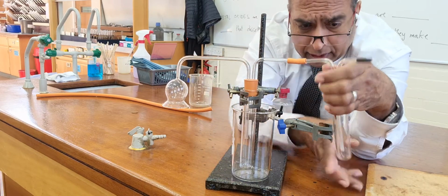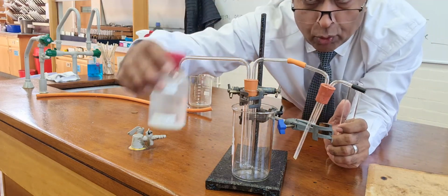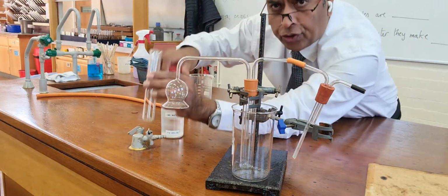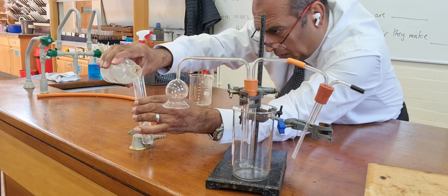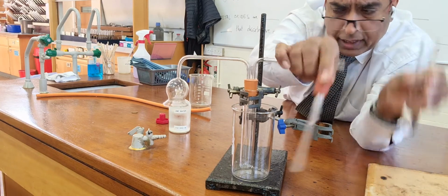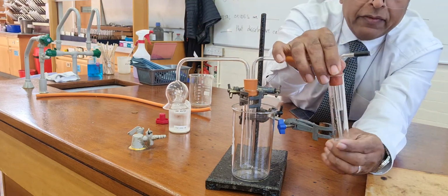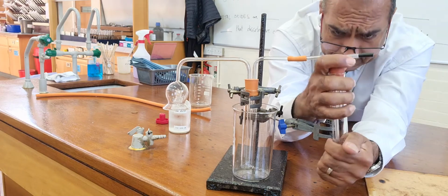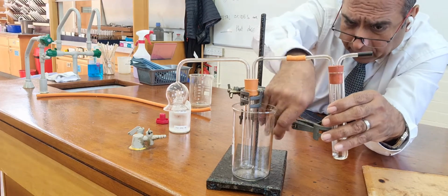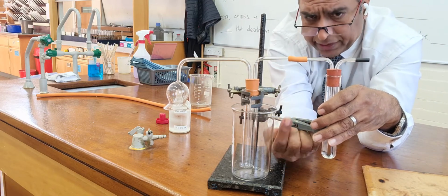And then carbon dioxide, I'm hoping to show you in this tube by having some lime water. If I get some lime water into this tube, and then if carbon dioxide is present here, the lime water will turn white. I'll pour some away because I don't want it bubbling over. The lime water should turn white as a consequence of the calcium carbonate, which is a white precipitate. So that's the apparatus.